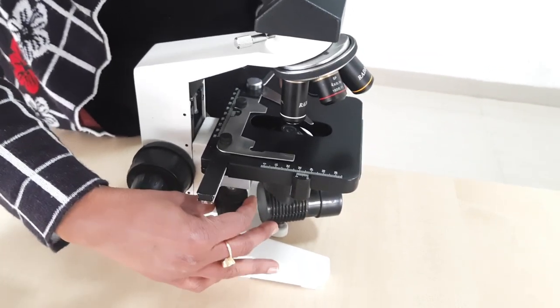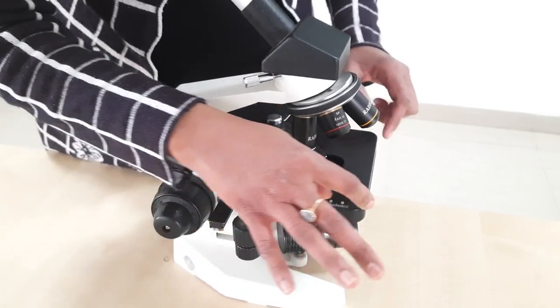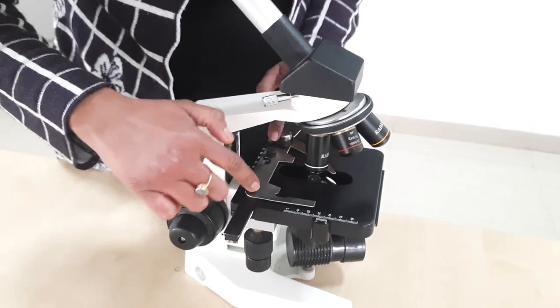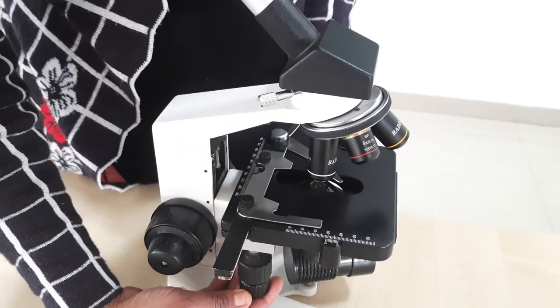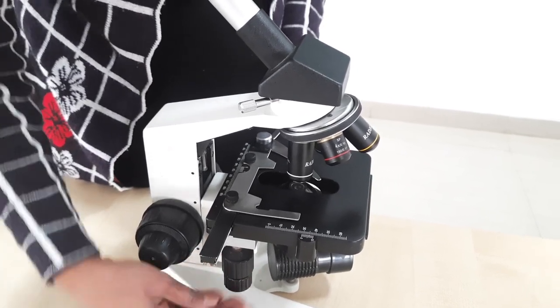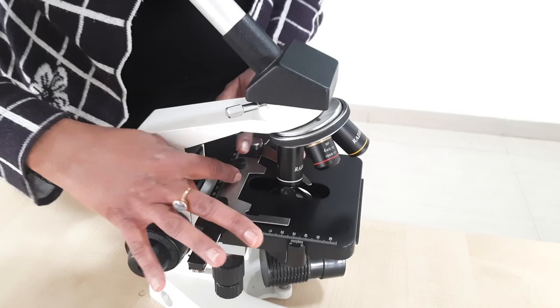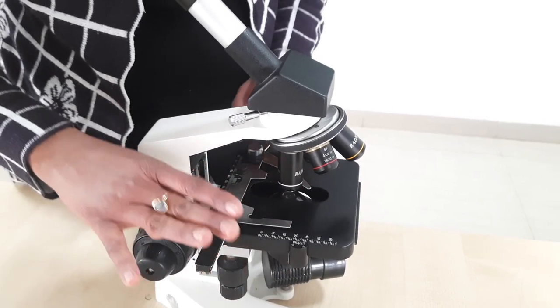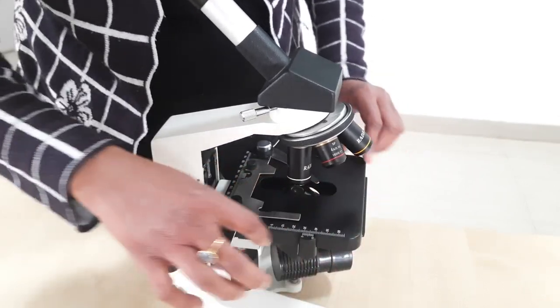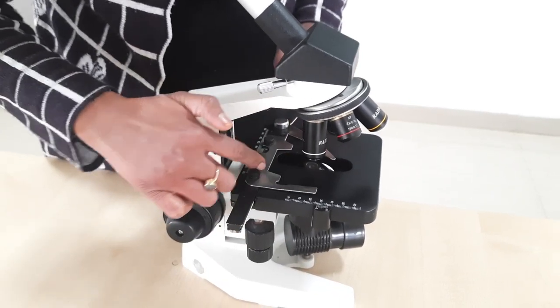There is a screw that moves the lower quadrangular plate anteriorly and posteriorly, and a second screw for the mechanical stage which moves right and left. In older microscopes only the mechanical stage used to move in both directions, but in this modified version both portions move.